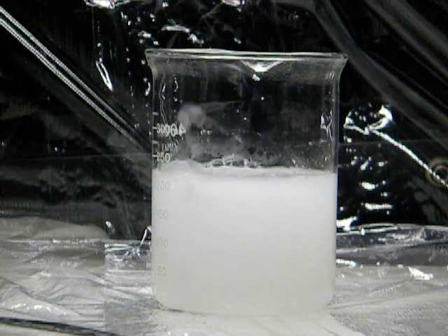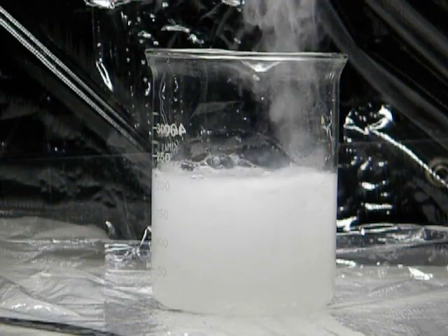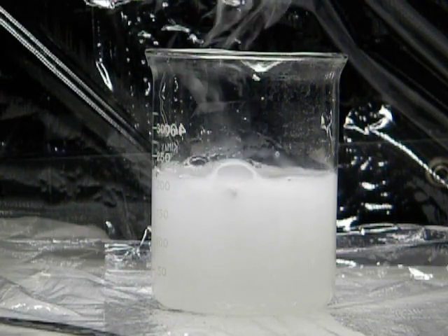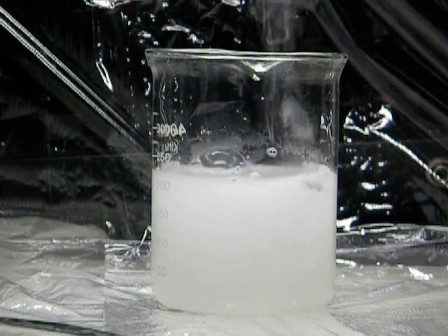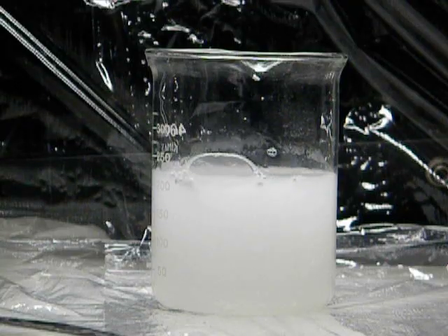Little puffs of gas being given off. What you're seeing is the water vapor. You're not actually seeing the gas that's being given off. The gas that's being given off is hydrogen gas, it turns out.